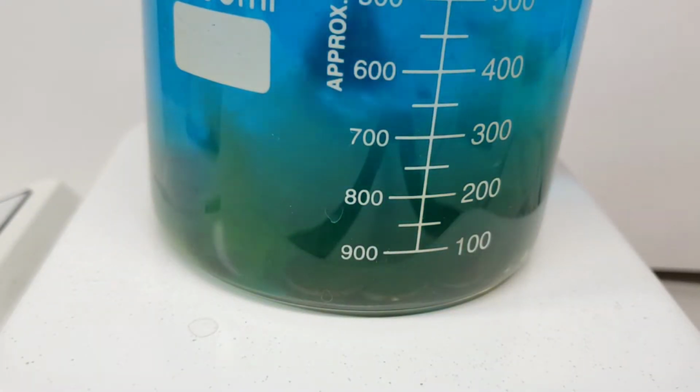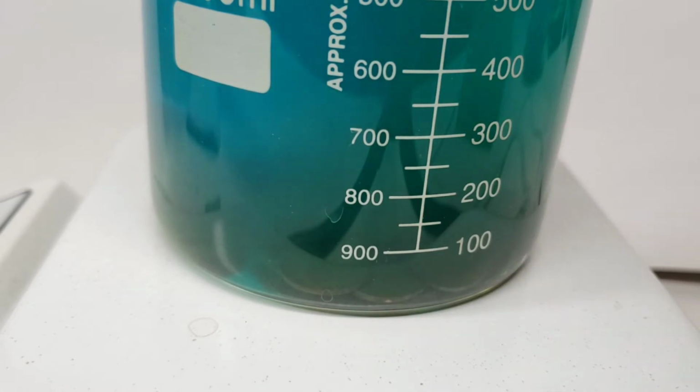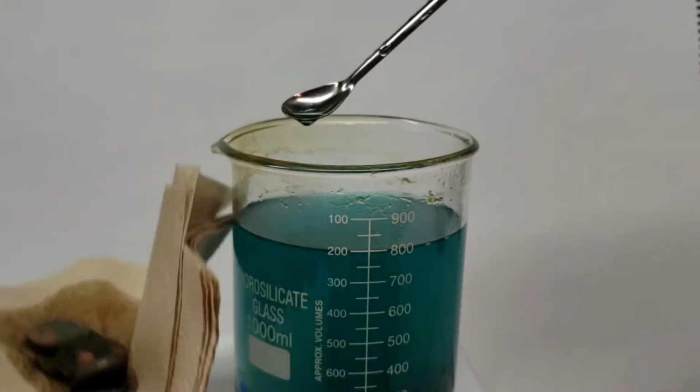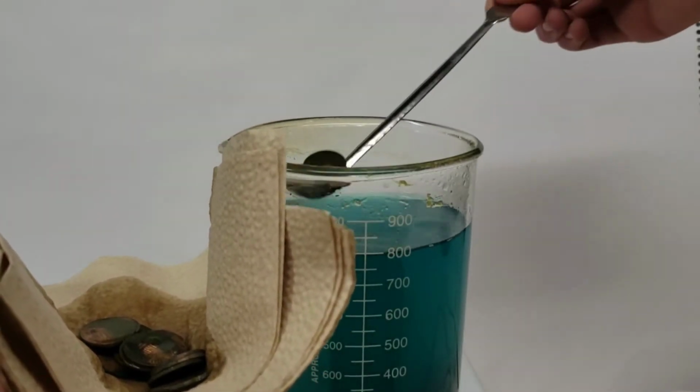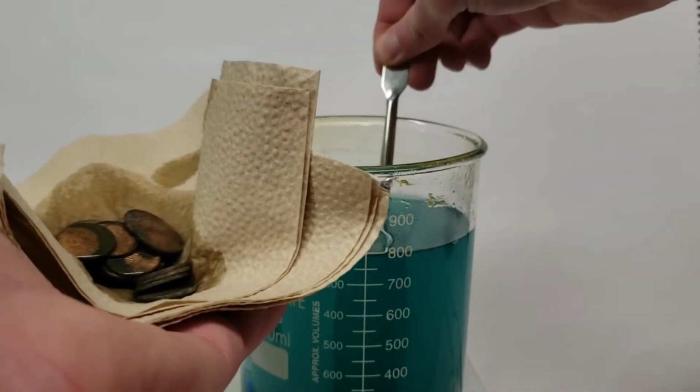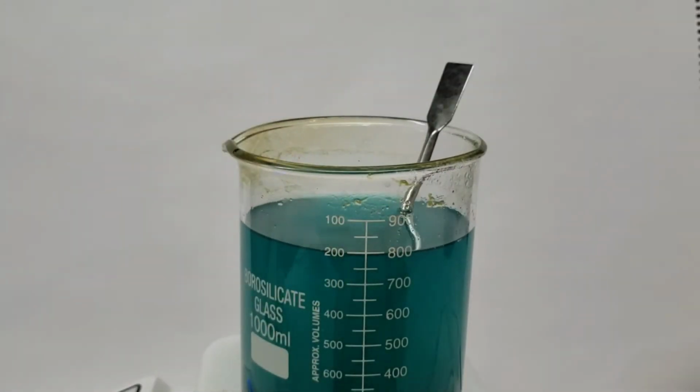And as you can see, there's a lot of floating greenish stuff that's built up in the bottom area of the beaker. Along with, of course, the pennies that are left over from the reaction. Which I chose to remove just by using a little spoon and a napkin to put them in. Please don't criticize me for this. I do know that it's dumb and I probably lost a little bit of the yield from that. But there are other dumber things I did further down the line, which you'll see.